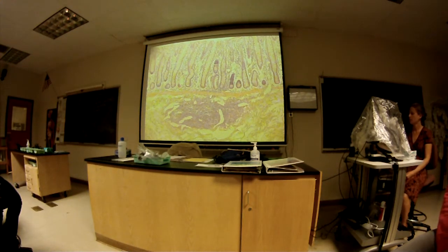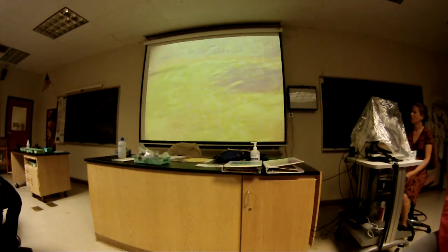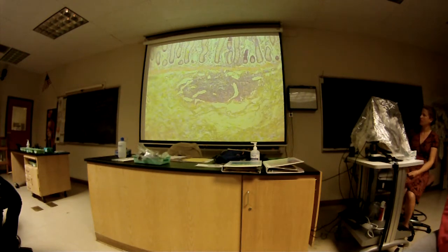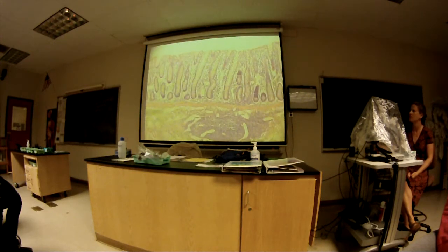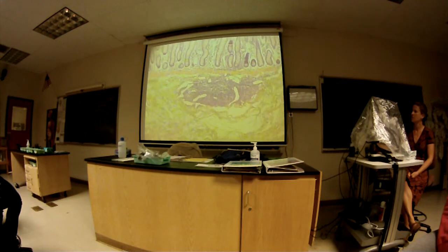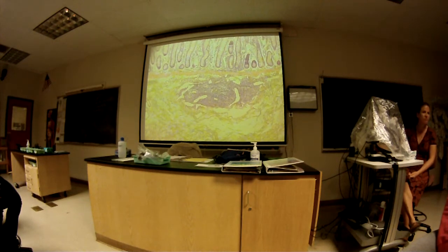Is that the same thing as a Peyer's patch? No. Almost. It's just one singular structure by itself. And so this is another identifying factor for the colon. You see one of these by itself. I'll give you a good view. If I'm asking for what this organ is, I'll do the best I can to show you the identifying characteristics.